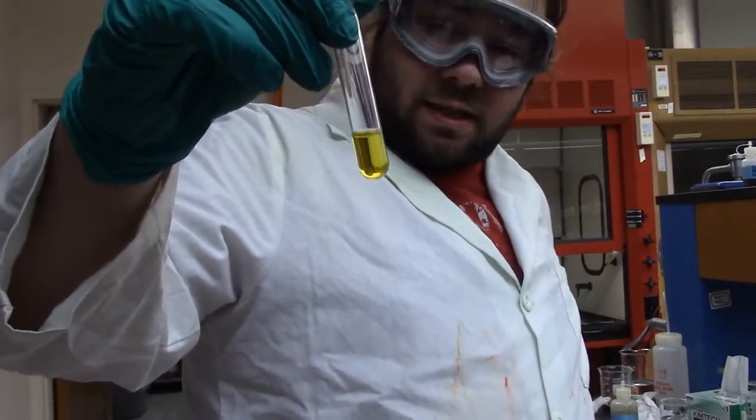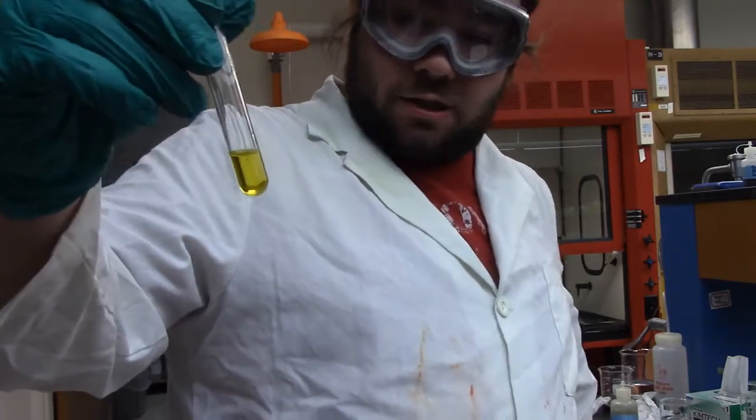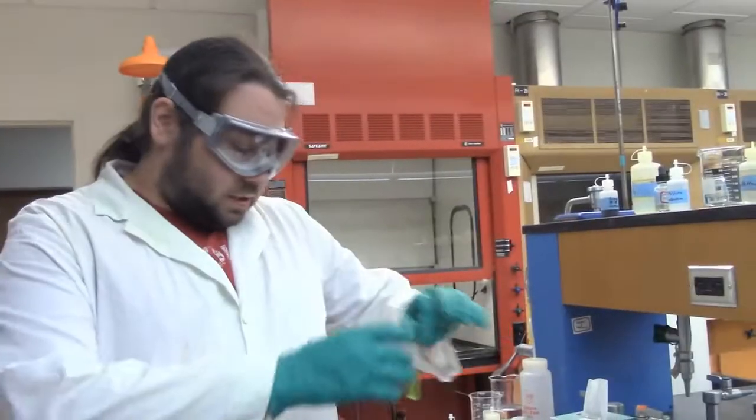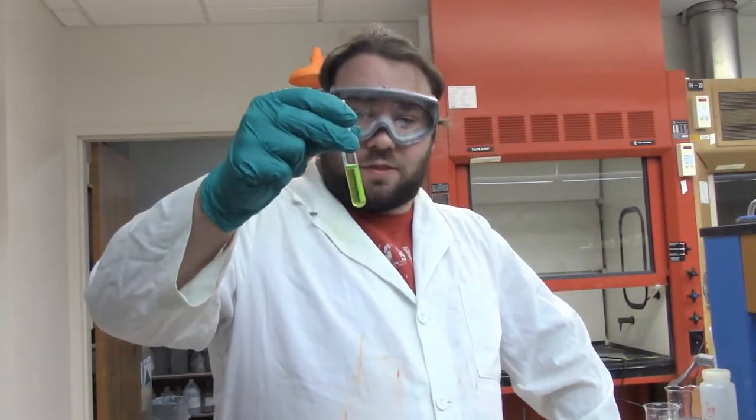So, lastly, for the last time in this video, you guys tell me, did we have calcium or not? And with that, we are done with our group 4s and all of our unknowns. So just to recap quickly, we started with this nice green solution. Look at that. We started with that.